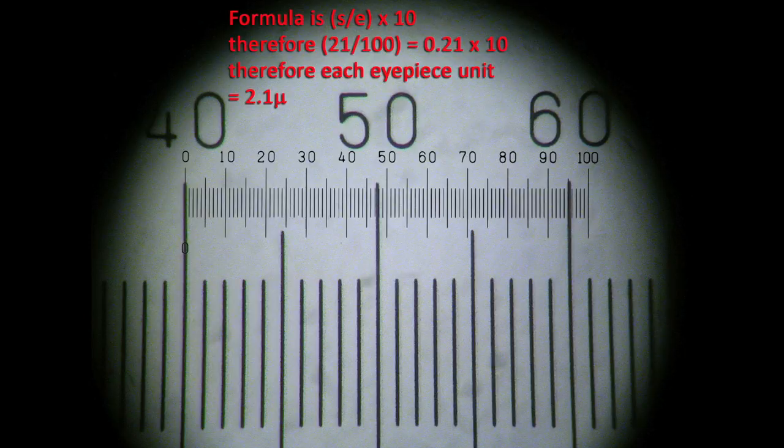And whether you use oil for the calibration is a matter of choice, but remember what I said about the perceived thickness of the marker lines on the magnified slide scale. If you want to be as accurate as possible, I would get the clearest image you can by using oil immersion.